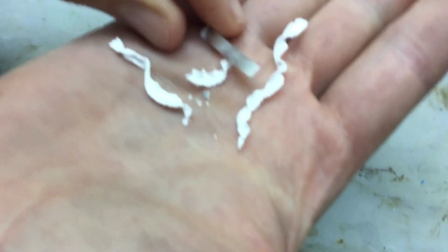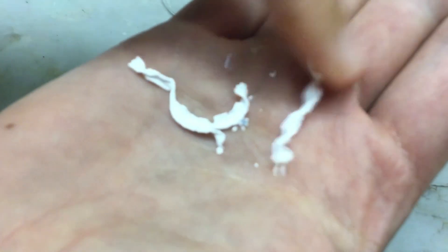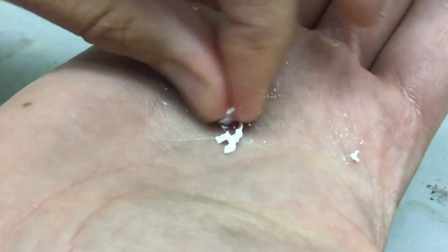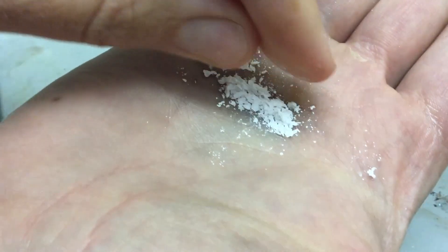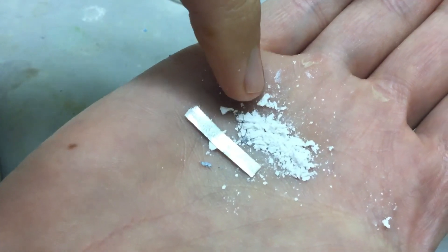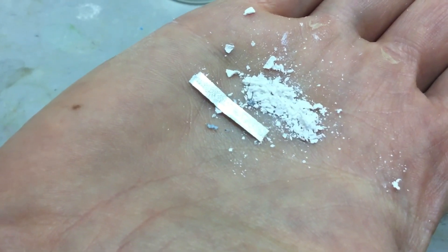So now what I have left, now that it's done reacting, here's my sample of magnesium. And here's the white magnesium oxide. It looks far different than the original sample of magnesium, which was a metal. But when it reacts with oxygen it makes the magnesium oxide solid.